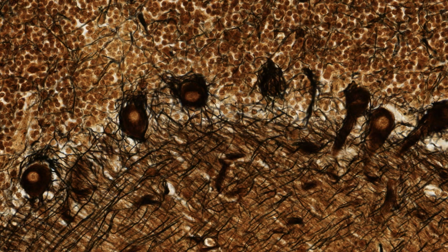In this scenario, a silver stain was used, and it's commonly used in looking at nerve tissue. It demonstrates processes of neurons, and it also shows you the neuron cell bodies. This is a very dark stained section, but all those black thread-like structures you see scattered about are nerve cell processes, axons and dendrites.